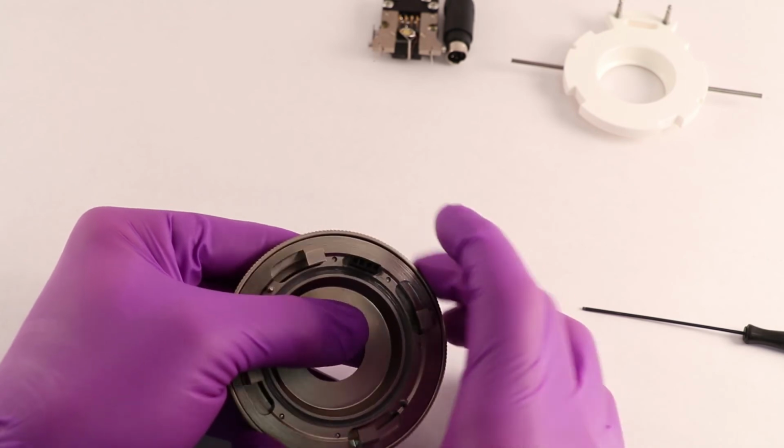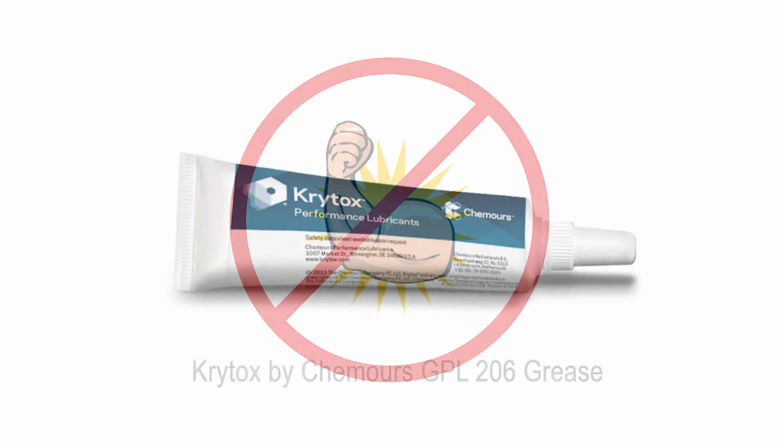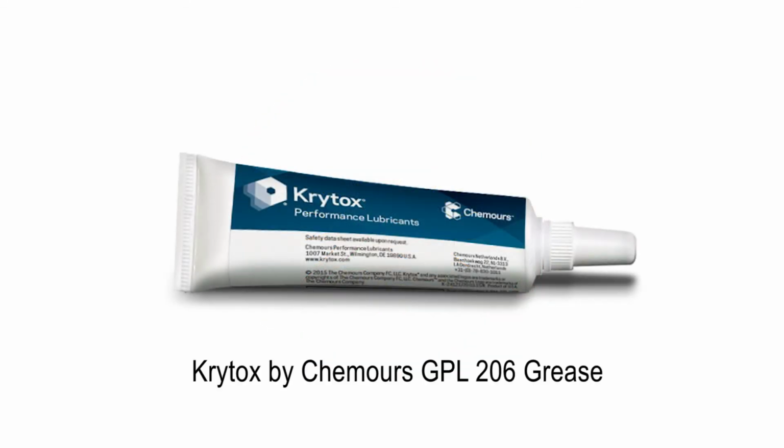How to prevent this from occurring in the future. Step 1. Don't force the chamber past its hard stops. Step 2. Make sure the threads on the 4-paw ring and knurled ring are greased.